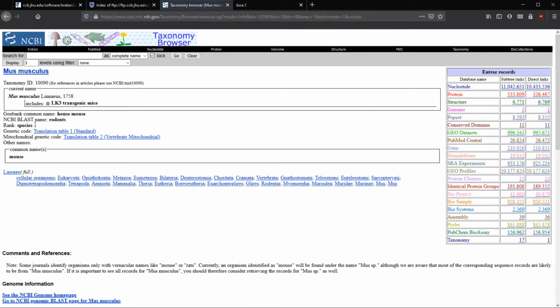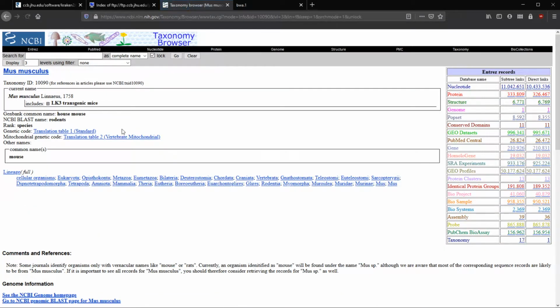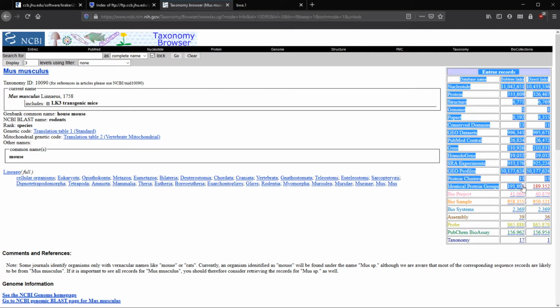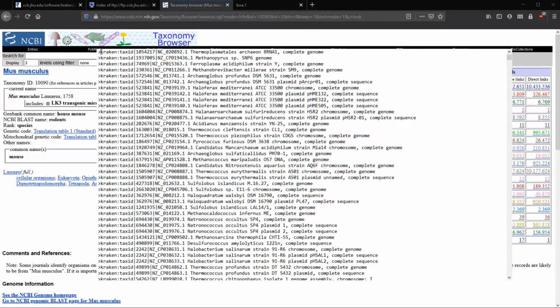And then here we'll select the main one again, because we want to include all of the mice. So Mus musculus. On the right-hand side, we have our Entrez records, all of these. What we're interested in is going to be nucleotide. But on this page, we also see here, we have the tax ID. So we can search in our notepad, bring that back. In here, we can do find.